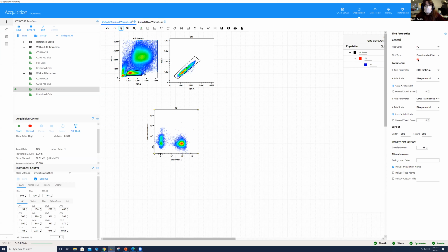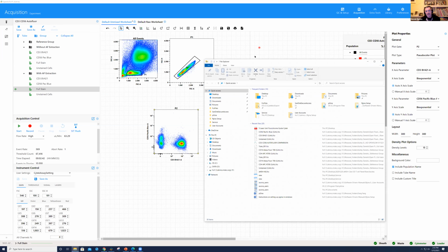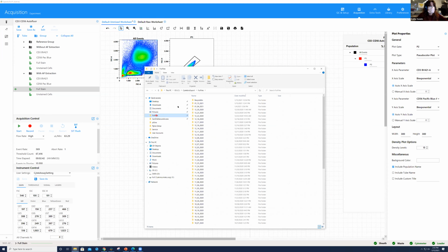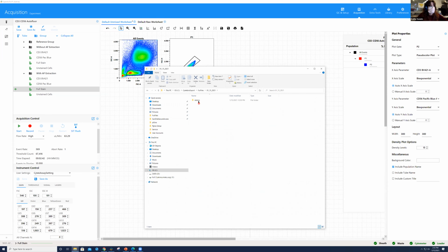So the data that comes out of the Aurora is the unmixed data, isn't it? It's not the raw data. Well, you get both. So you could run that raw data through a different algorithm. Exactly. The file path that we have here, today we're in the admin account, and we did this test run. We get a raw output and unmixed for every FCS file from each group. So you have both of those folders that will pop up, for raw and unmixed.